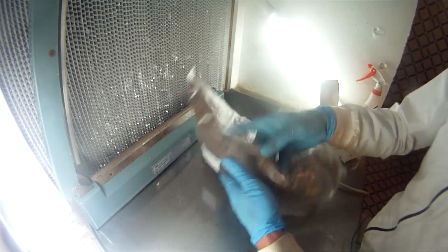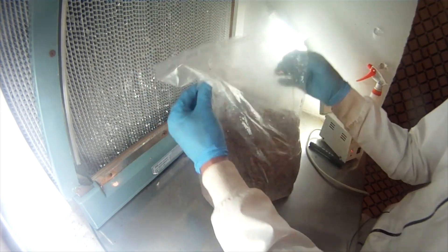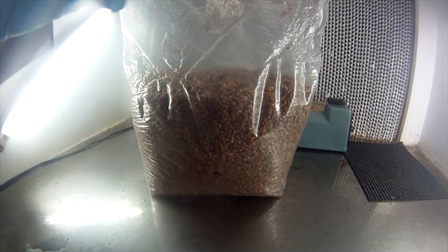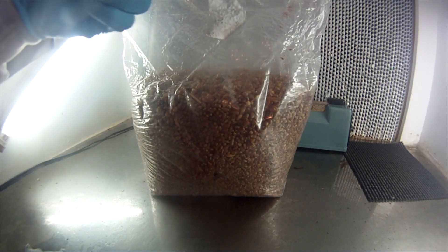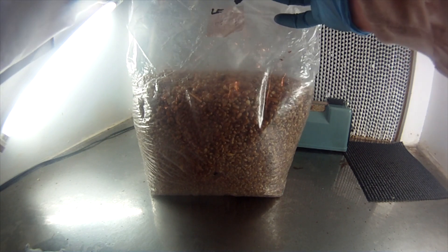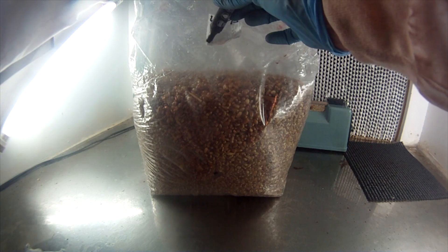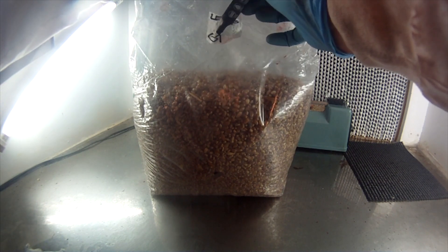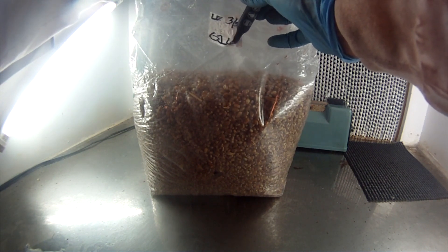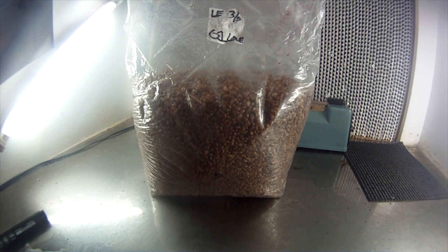Then we're just going to mix it up. These agar chunks — I'm trying to distribute them evenly. You can obviously do this horizontally or vertically. Grain mixes up nice and easy. So that's it, folks — we are mixed up in there. Obviously, you want to label this. This is Lentinula edodes. I like to use the Latin; most people use the Latin. This is old footage, so this is like March of a long time ago. I use the Stamets method — so that's grain spawn one, the first generation from the petri dish.